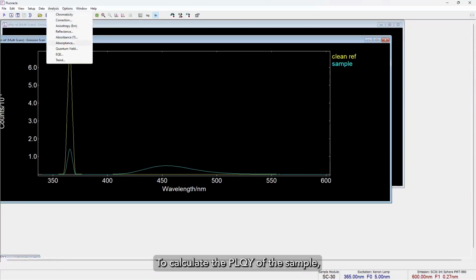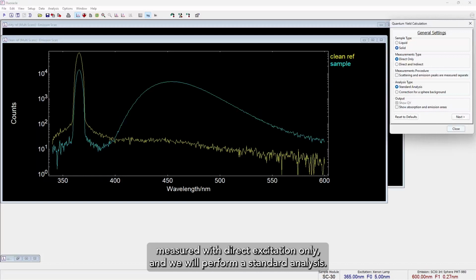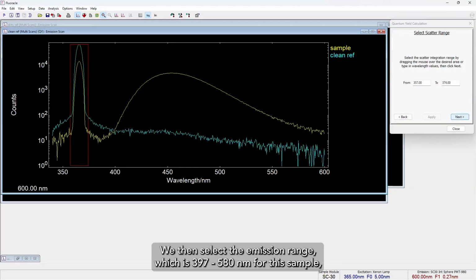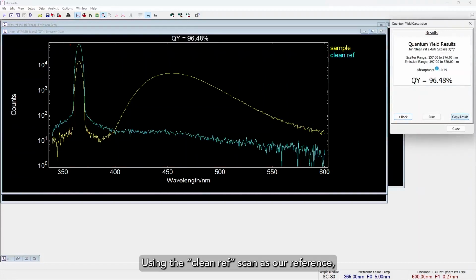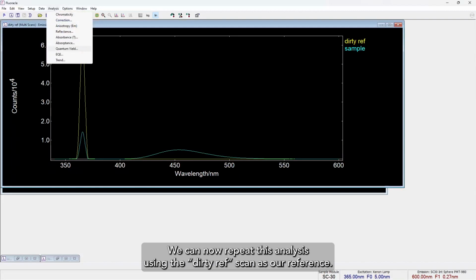To calculate the PLQY of the sample, I will select the Quantum Yield Wizard of Fluoracle from the Analysis drop-down menu. Today, we are analysing a solid sample measured with direct excitation only, and we will perform a standard analysis. We then assign the sample and reference scans before selecting the scatter peak range, which is 357 to 374 nanometers. We then select the emission range, which is 397 to 580 nanometers for this sample, and Fluoracle calculates the PLQY. Using the clean ref scan as our reference, this was determined to be around 96.5%, slightly higher than the expected 93% of this sample.